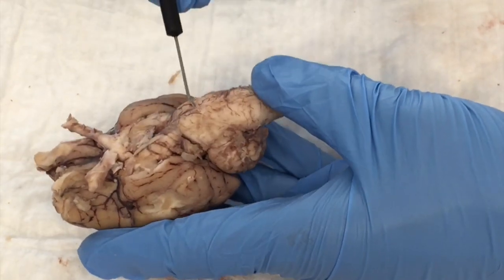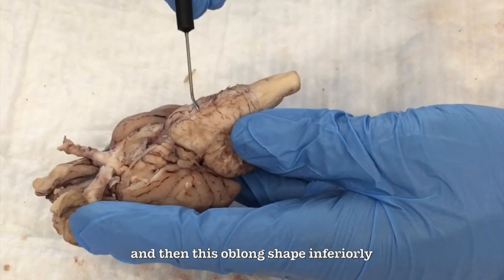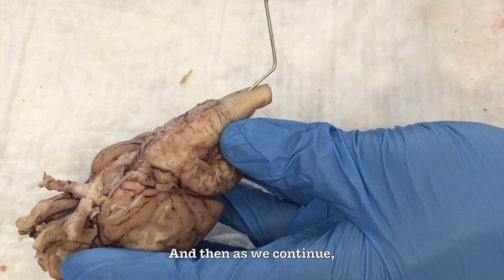As we continue down, we see that this first bump right here is the pons, and then this oblong shape inferiorly is the medulla oblongata. And then as we continue, we see the spinal cord.